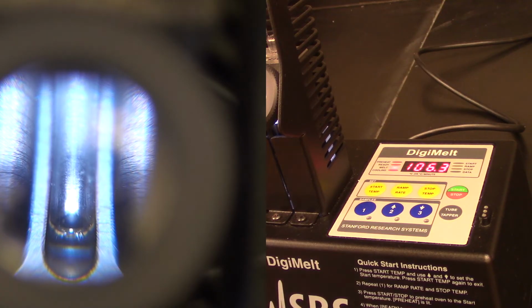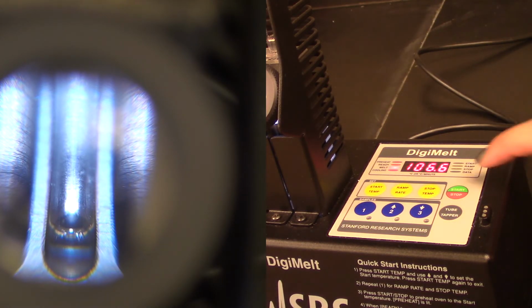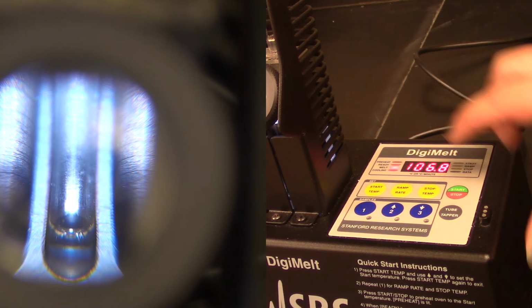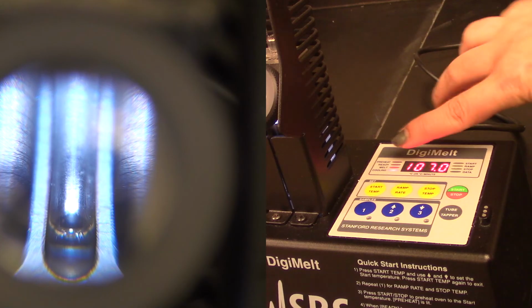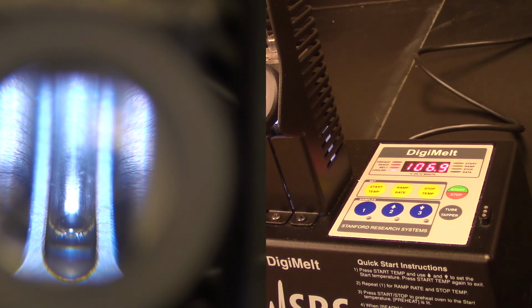The very last thing that you have to do with the melting point, when you are finished recording the melting point range, is this is going to continue heating up unless you hit that start/stop button one more time. And so what we want to do is get this to go from melt into cooling mode. So just hit that again, and what that's going to do is allow it to cool back down below that preset temperature so that it's ready to go for the next person. And so once you have it in the cooling, you are all set.